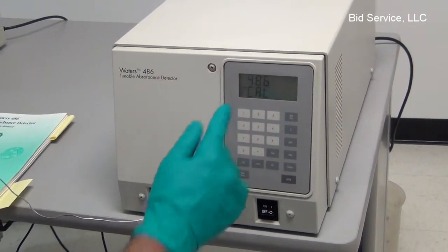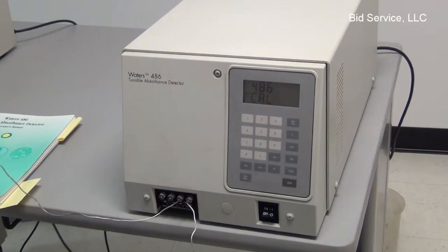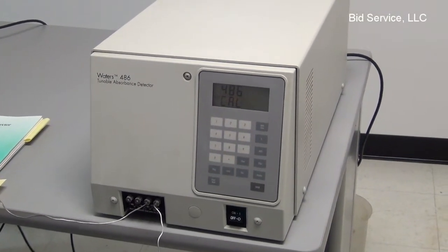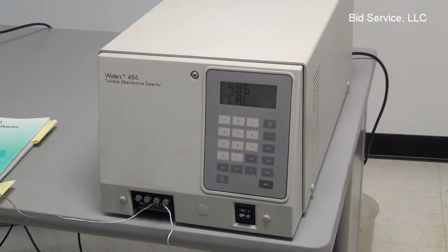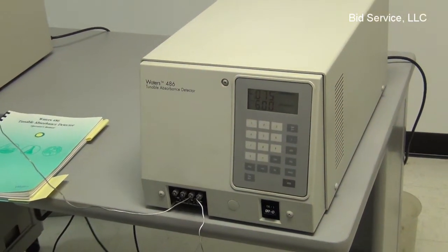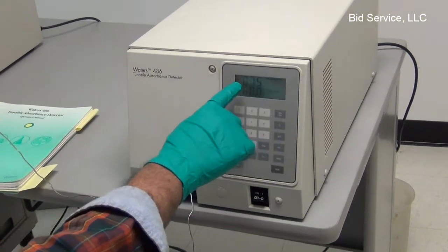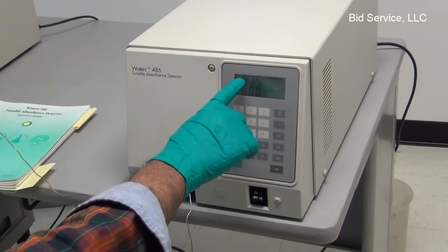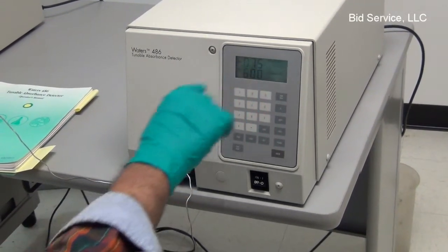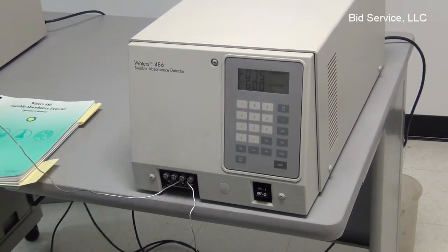Once the calibration is finished, the system will initialize to the last set wavelength. The unit has just finished calibration and is indicating the wavelength. There are two display lines: the upper LCD display indicates absorption or transmission, and the lower display indicates the wavelength.